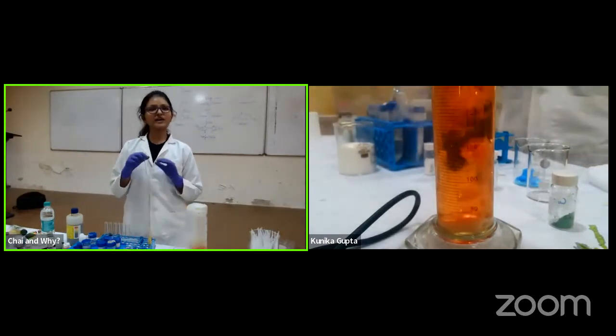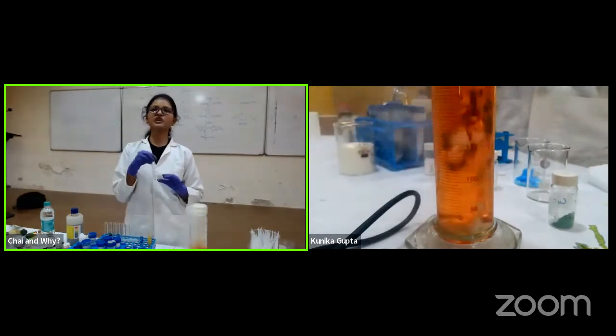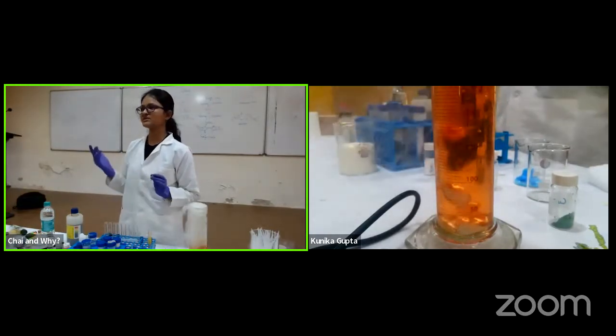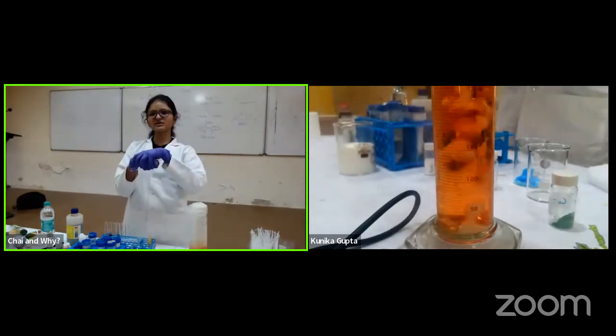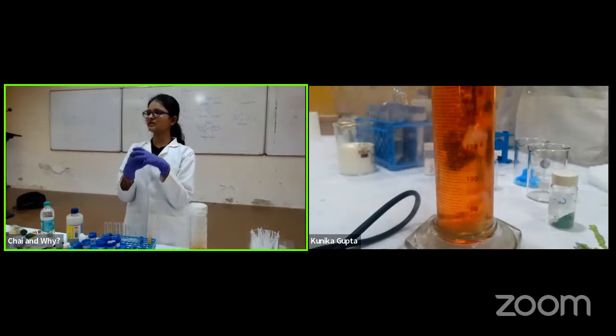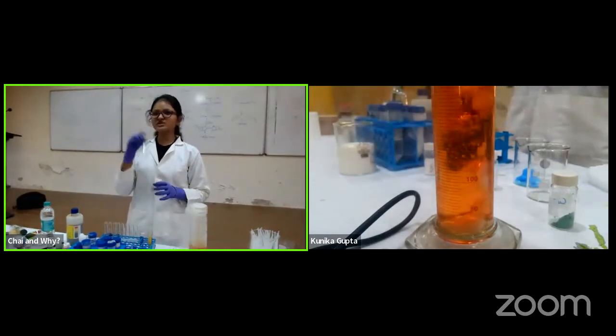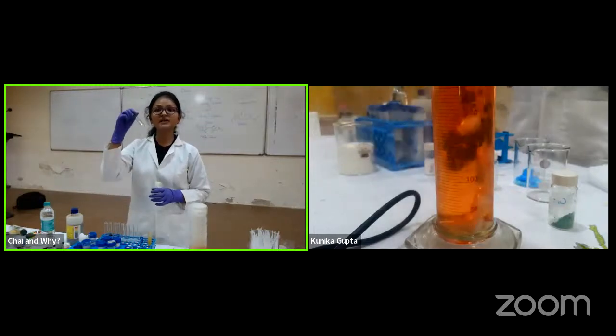So what should happen is that of all the salts I am adding, only the manganese should give me a turn on response, nothing else, because the ligand is a chelator, meaning whatever this binding unit is, it is going and binding to the manganese. So I checked in the test tube and it is working. Here there was only manganese, which is why it is working.